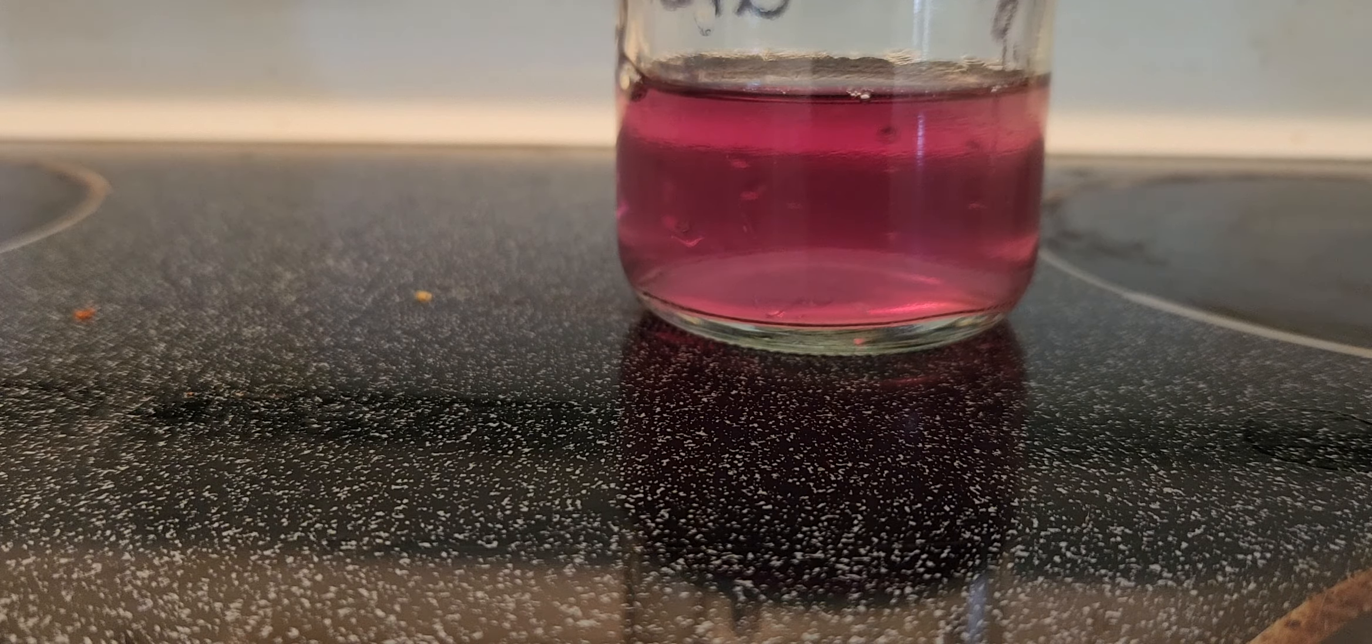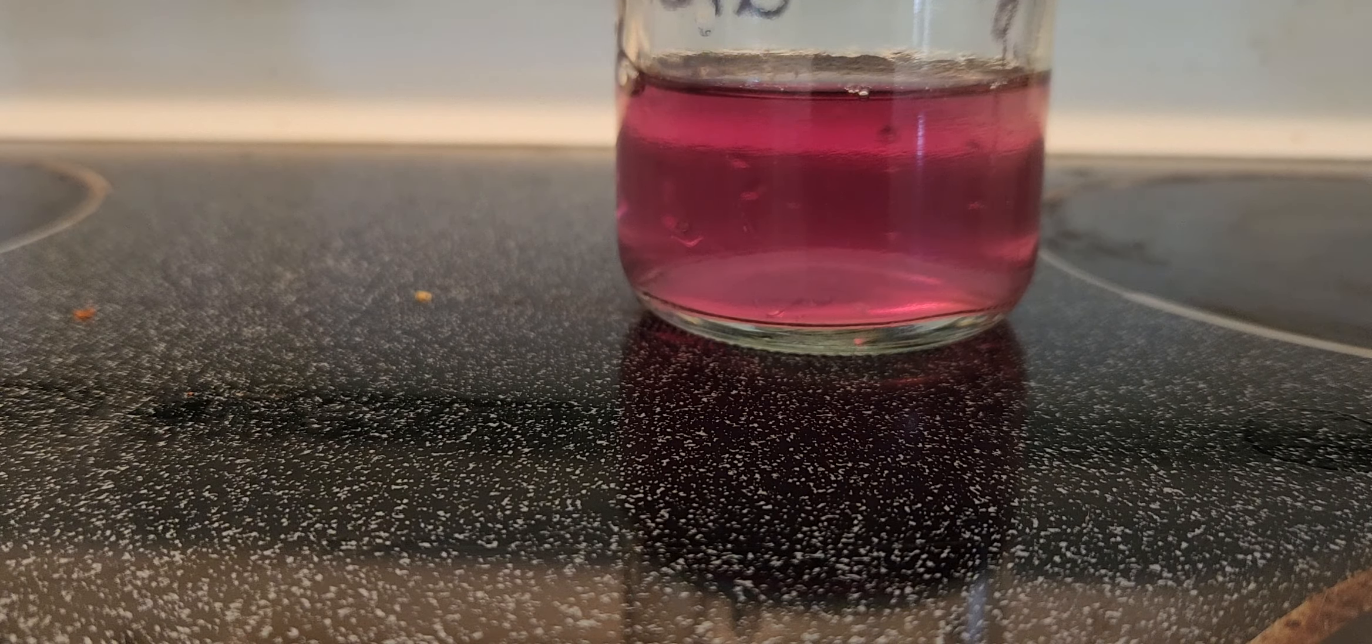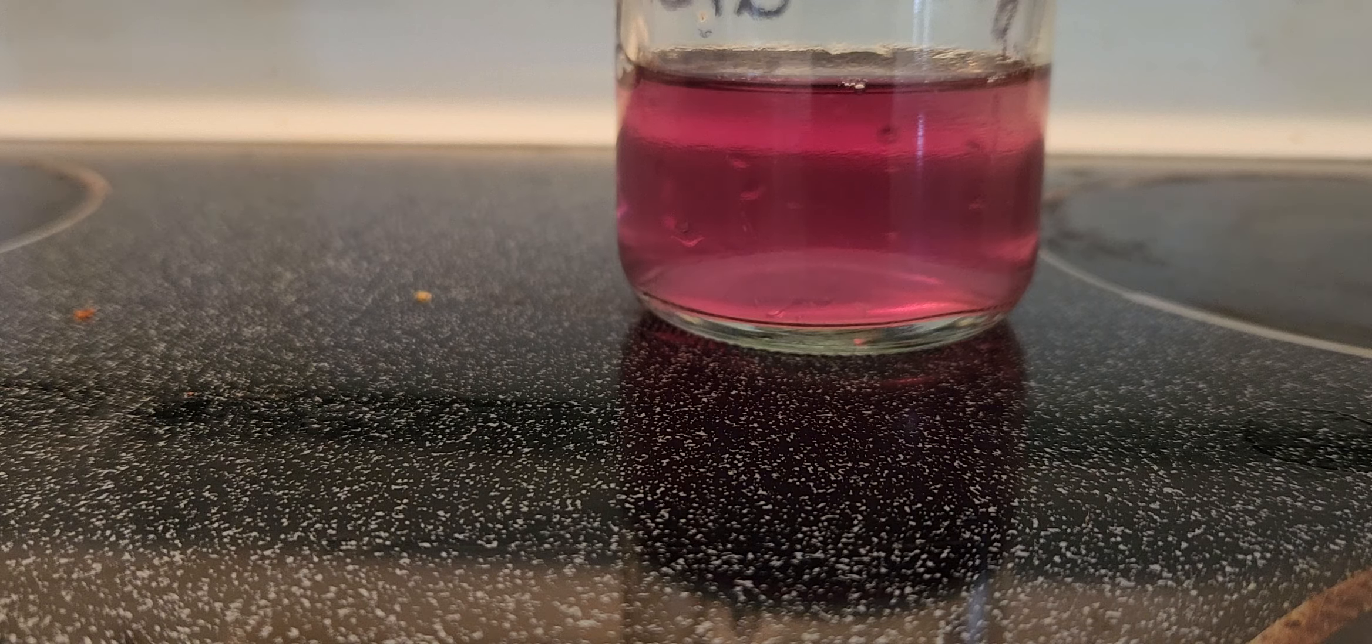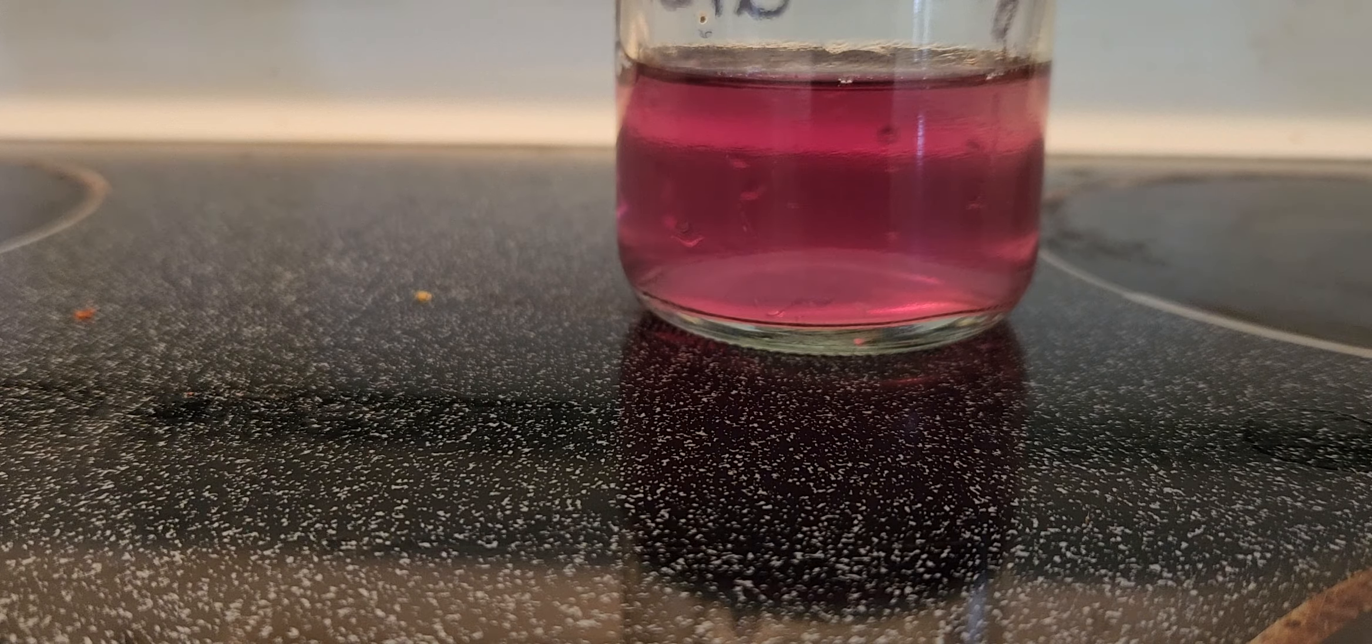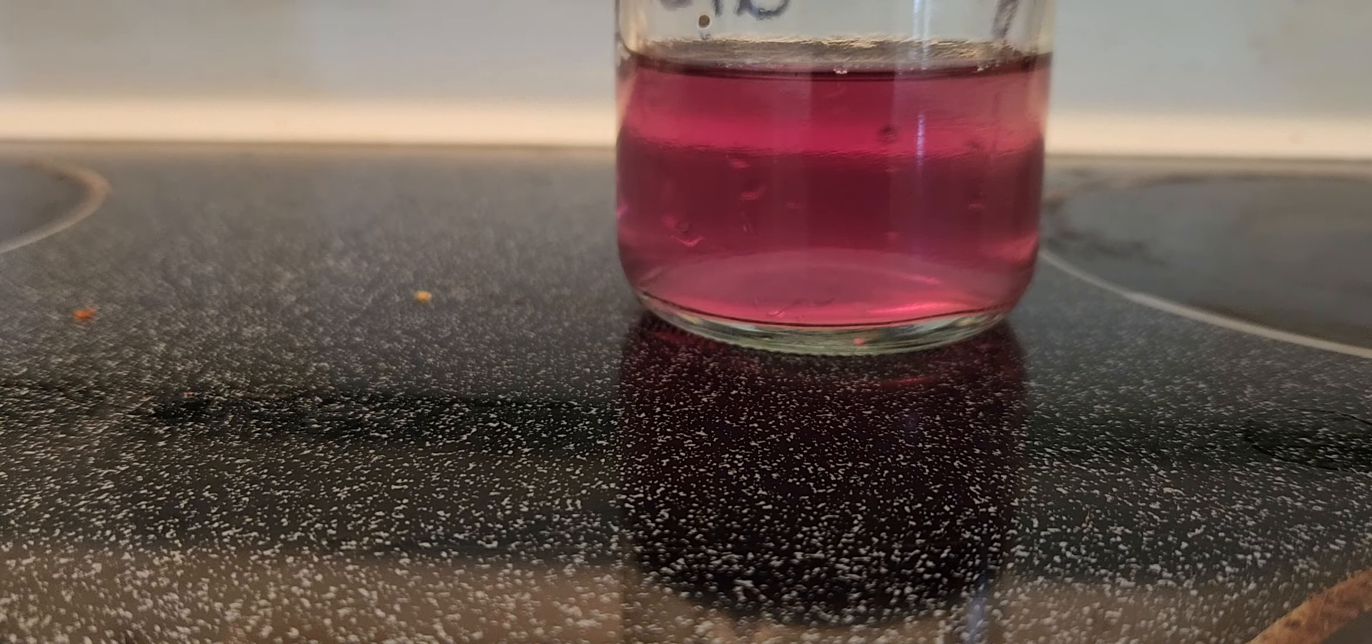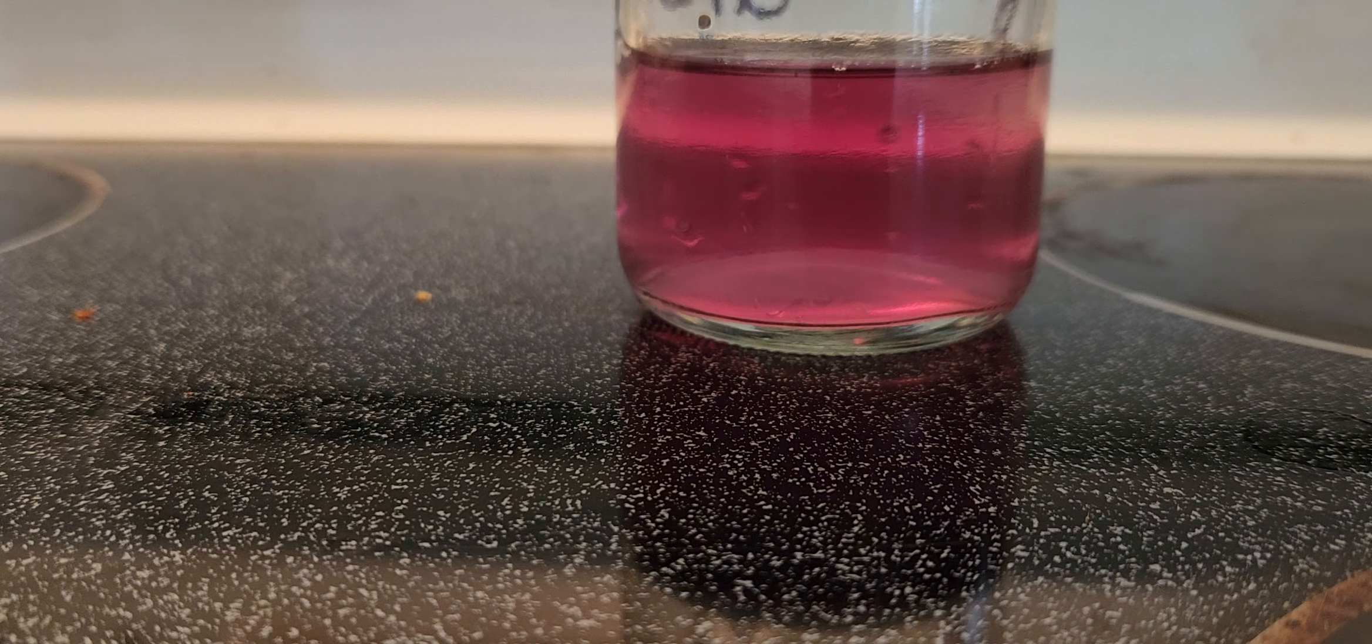See, it's the pigments, it's absorbed the flower and you get this lovely red color. If you add baking soda to it, it would make it change color.